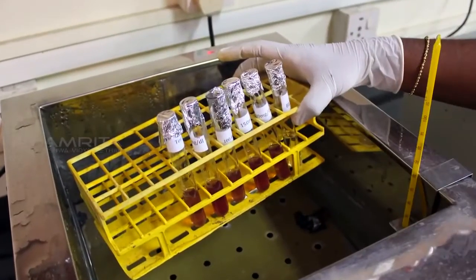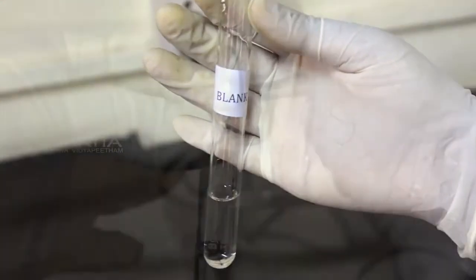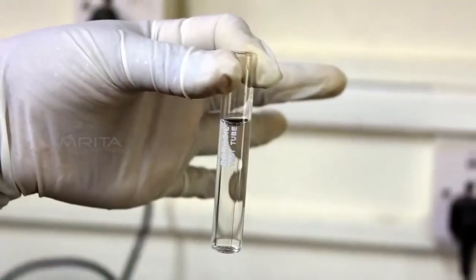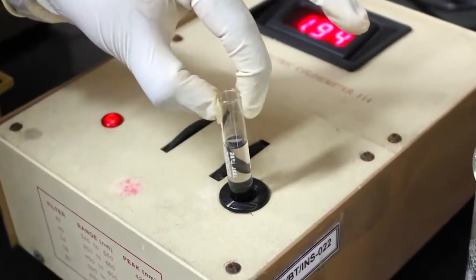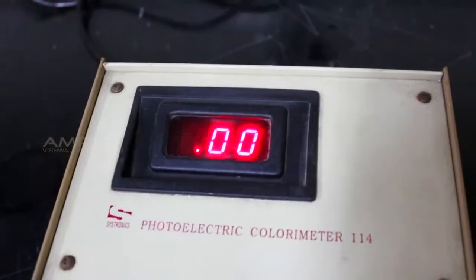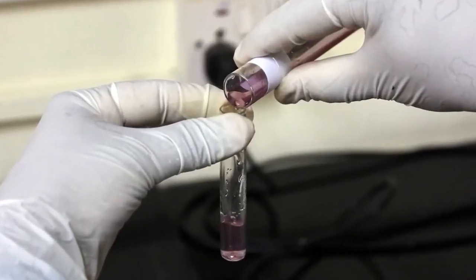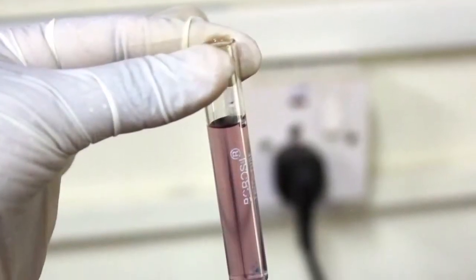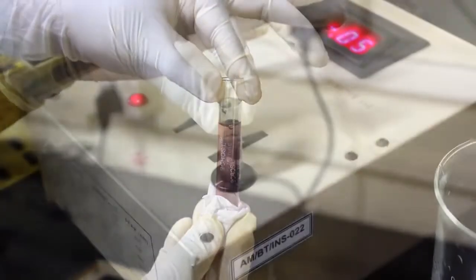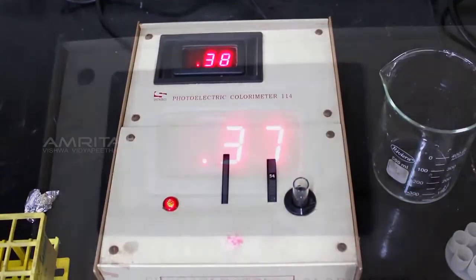After 1 hour, take out the test tubes from the water bath and transfer the blank solution to the cuvette. Insert the cuvette into the slot of the colorimeter and set the value to 0. Next, transfer the 50 mg per deciliter solution from the first test tube to the cuvette. Insert the cuvette into the slot of the colorimeter and note the reading.